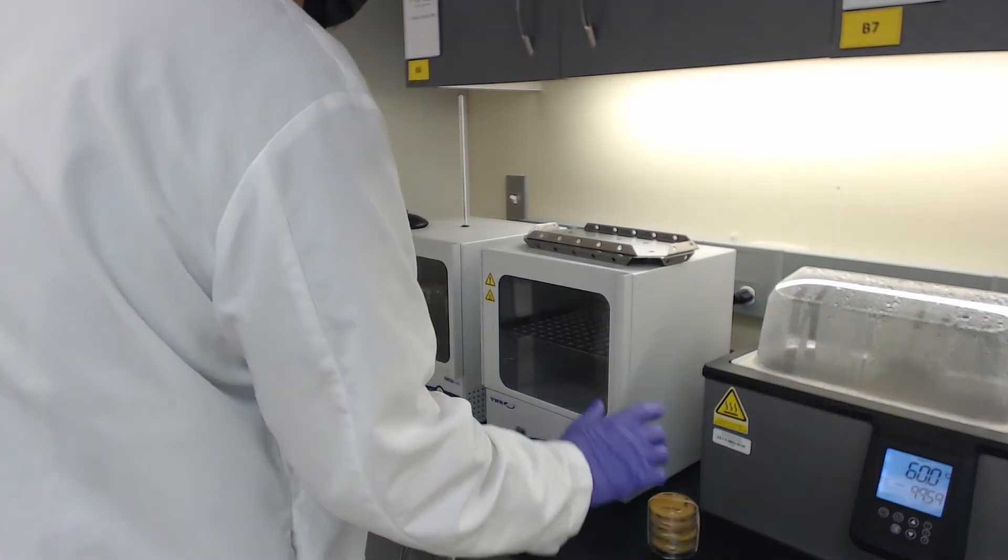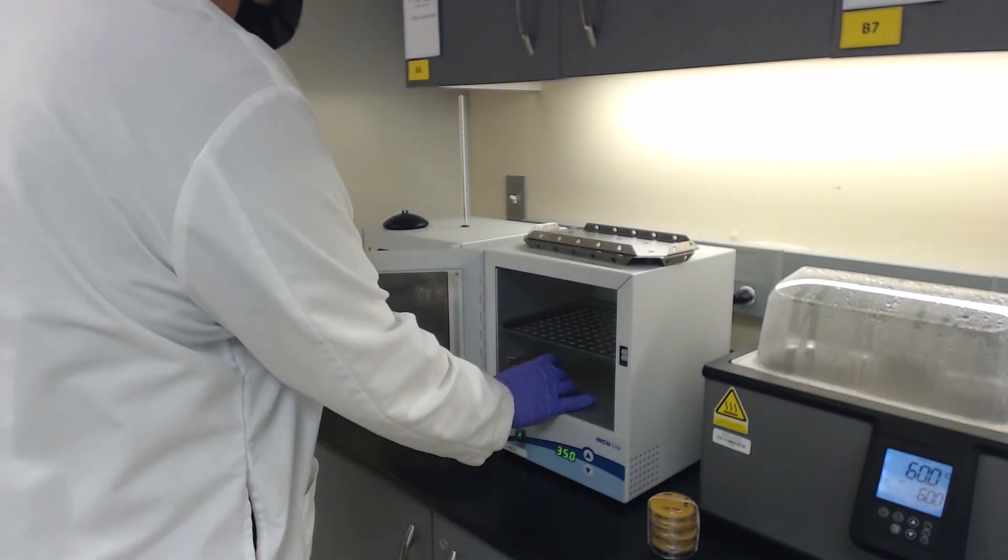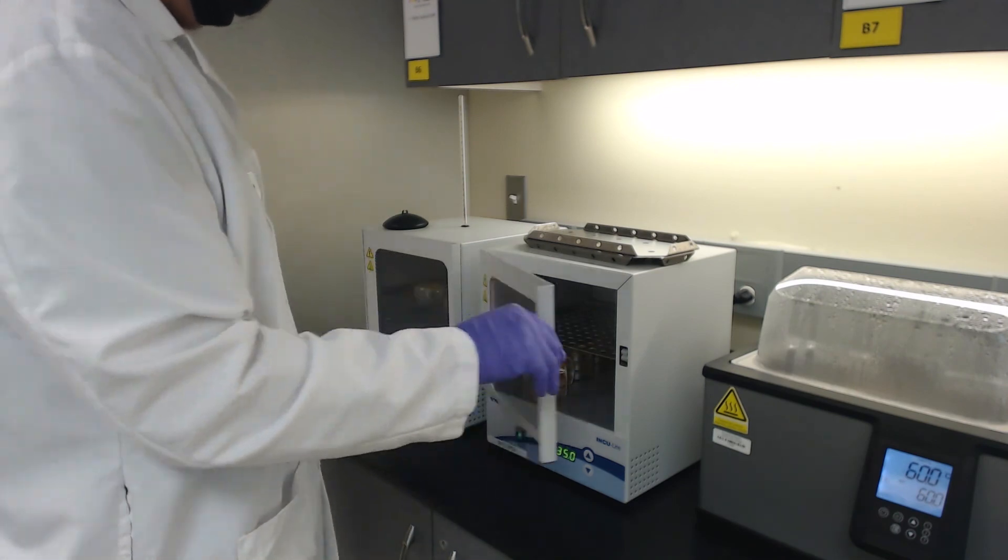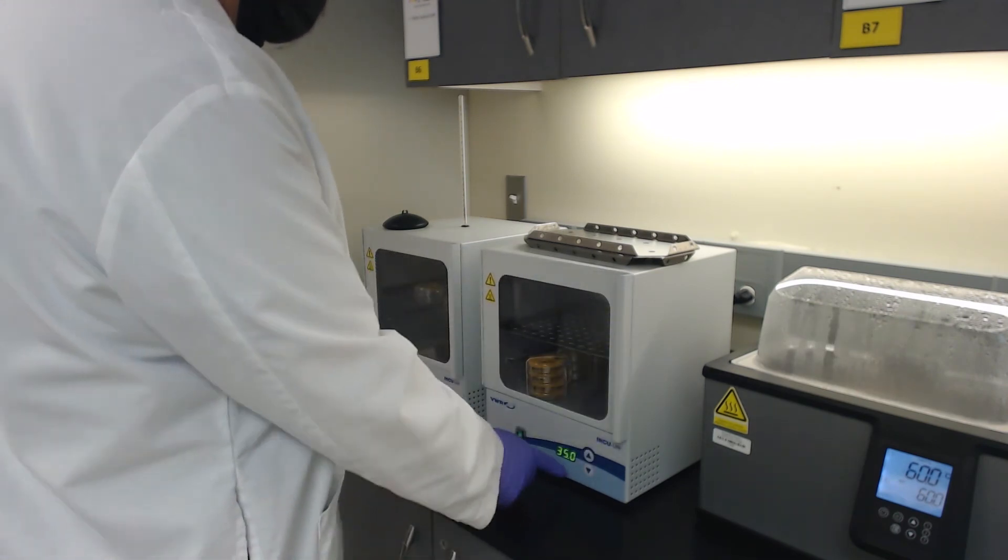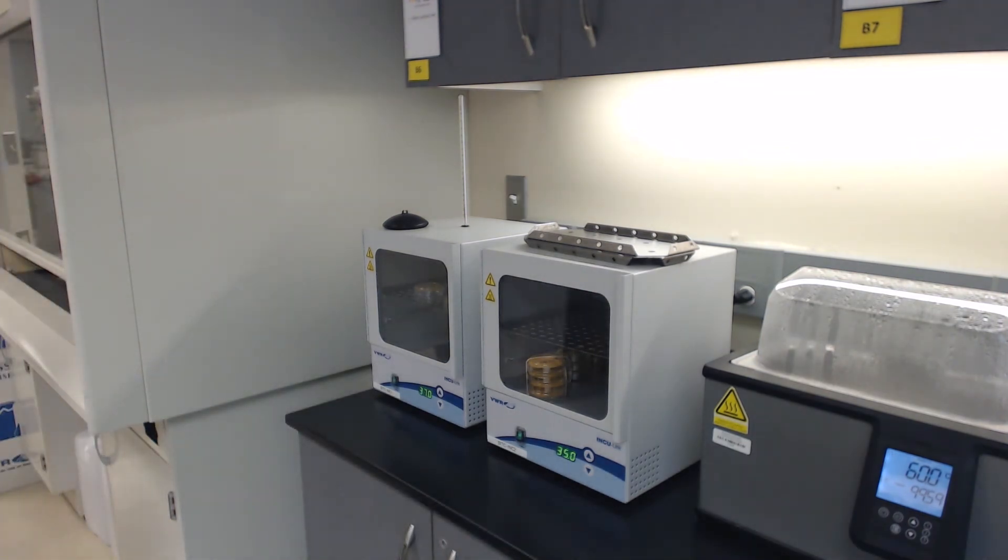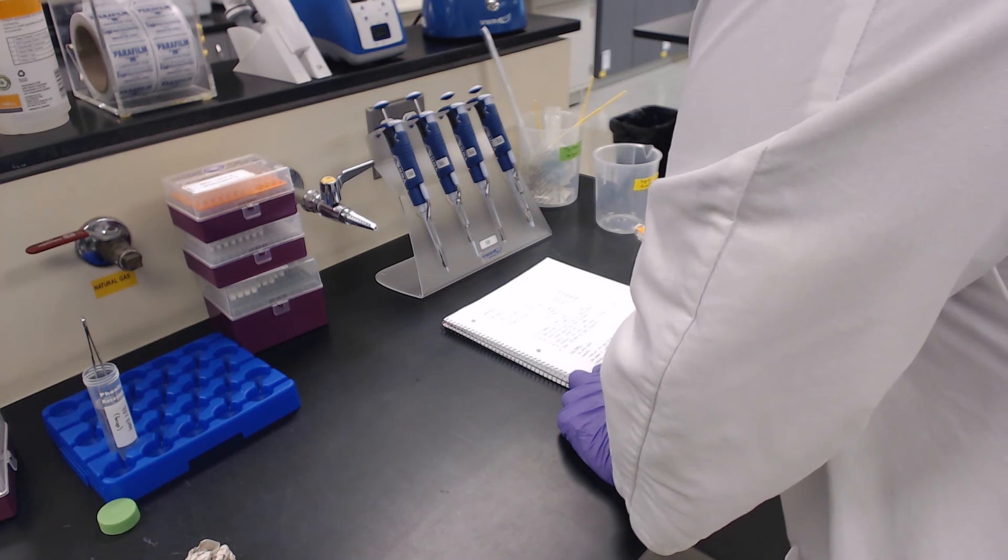When all your sample plates have been processed, place tape or rubber bands around the plates and place them in a 35 degrees Celsius incubator for 48 to 72 hours. Be sure to make a note of the exact temperature of the incubator and the exact time at which the plates began incubation.